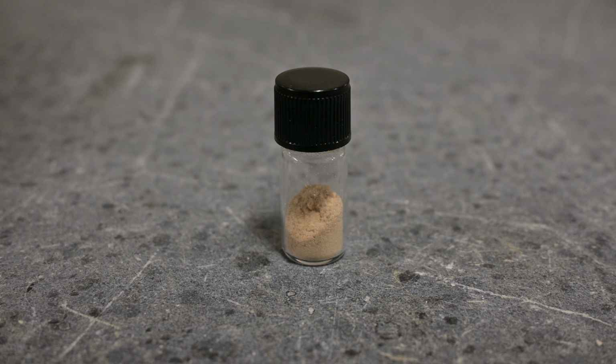So how do we know that we made triptycene? Let's take a look at it at the molecular level by using NMR. But first, let's start simple. One of the most common analyses one can do is melting point. This can tell you a few things, mainly purity and if it's the compound that you want. If it's the wrong compound, it'll melt at the wrong temperature. If it's impure, the melting range will be much wider compared to a pure substance.